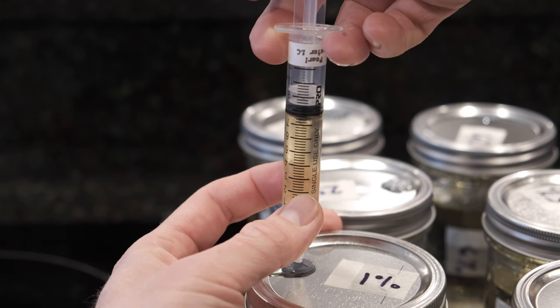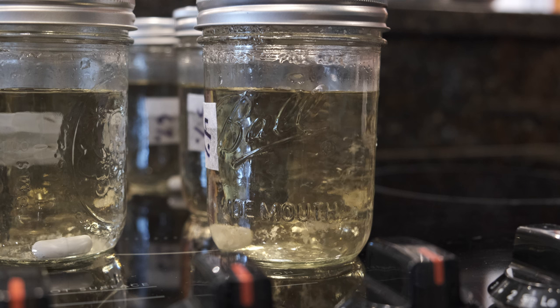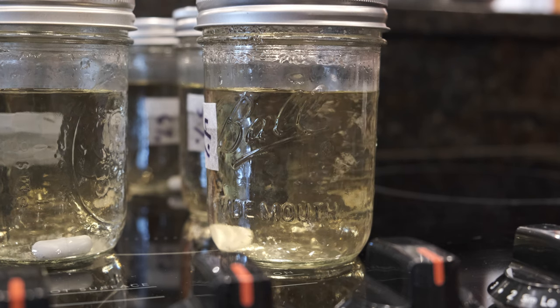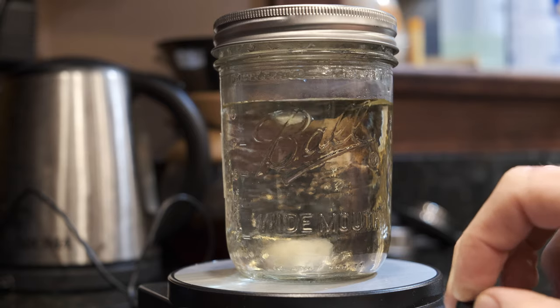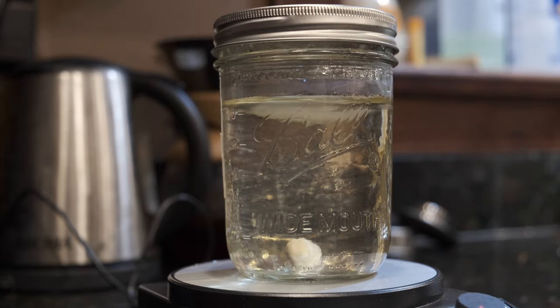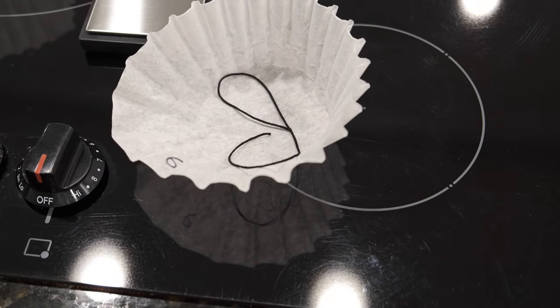They also gave me some pretty great advice on creating liquid cultures, and you'll see some of their advice baked into how we're doing this work here. I put three cc's of that liquid culture into each of these jars — just look at that mycelium float around, so gorgeous. Then back to the magnetic stir plate to mix that mycelium up with the nutrients. After that tornado subsided I put them all up in the cupboard and let them grow for 21 days. Here's how they looked after 21 days — it's kind of hard to tell who's the winner, but we're going to figure it out in a second.